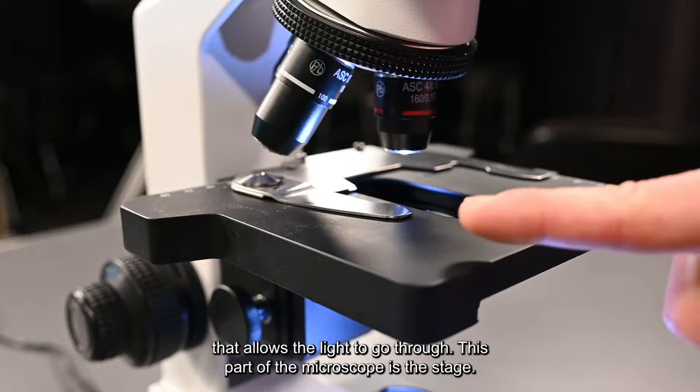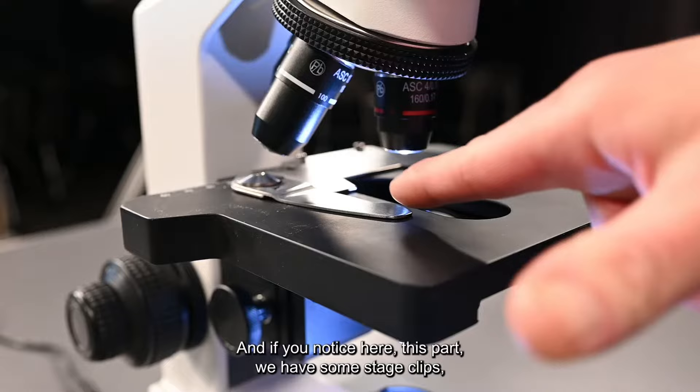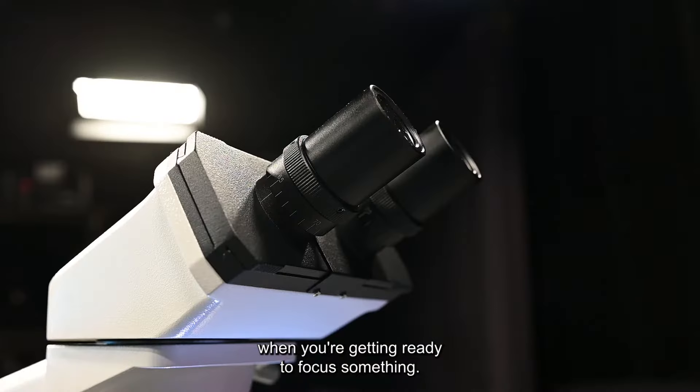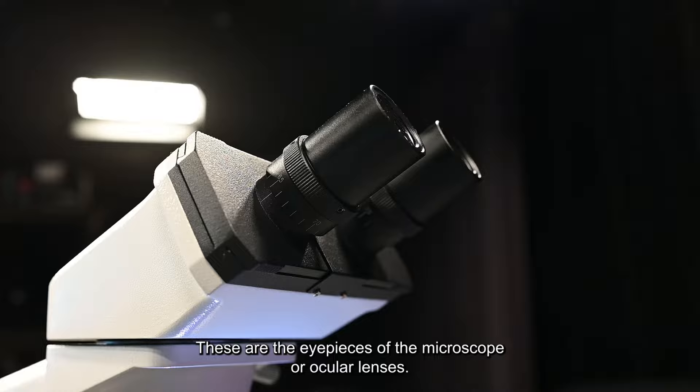This part of the microscope is the stage. This is where you're going to put your slide or your specimen. If you notice here, we have some stage clips and this is the area where you're going to put your slide when you're getting ready to focus something.